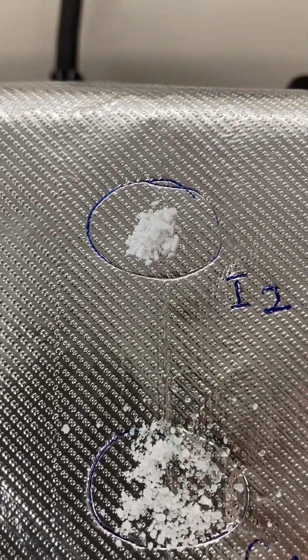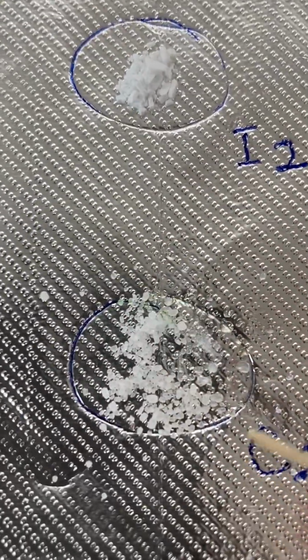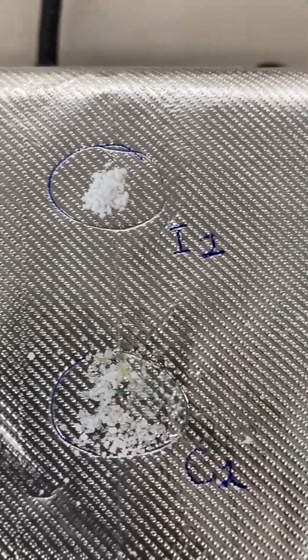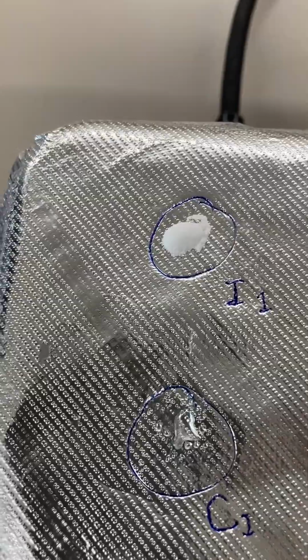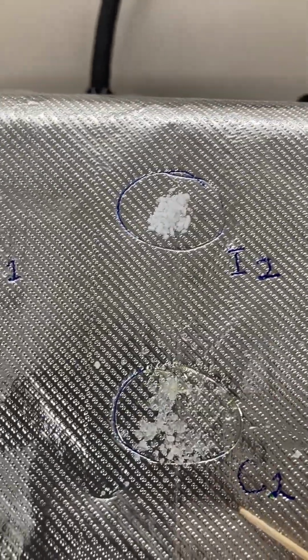Nothing yet. Oh, wait a minute, their crystals are kind of softening, and you can see right here they're actually melting. So citric acid is melting, and the fructose has melted. So we saw stearic acid first, fructose second, and citric acid third. And let's check in on our unknowns down here.